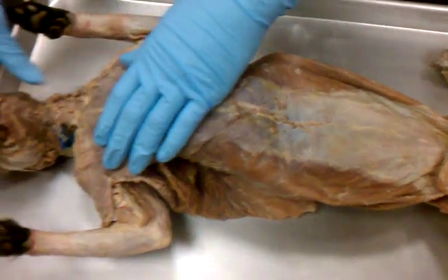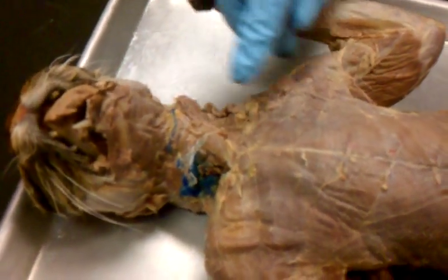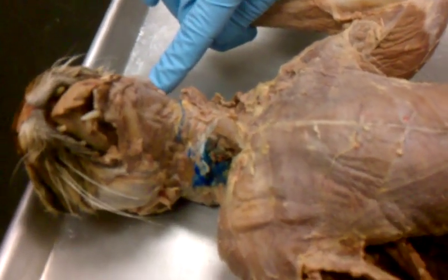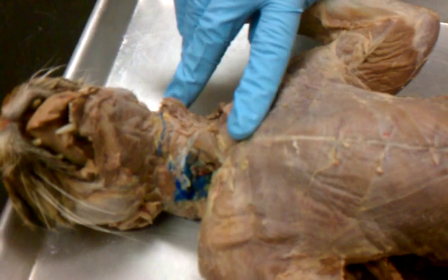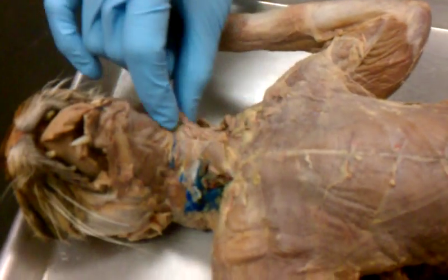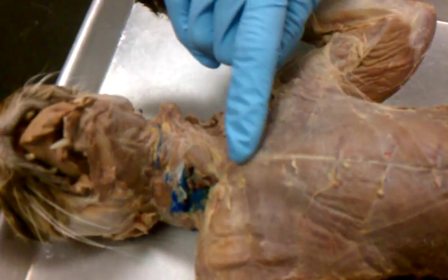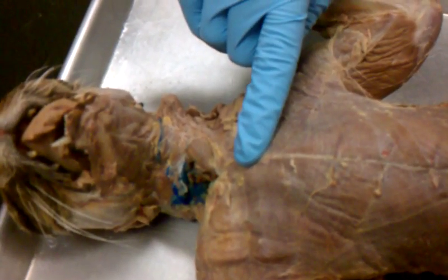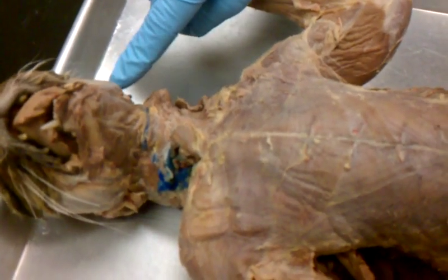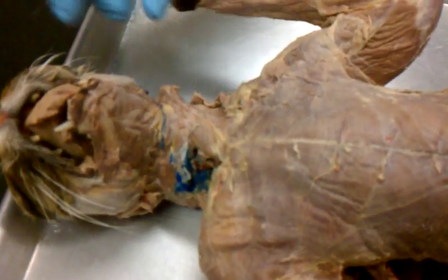Go for it. Okay, then you have this one in the neck that I told y'all is a good one to know because it goes from the sternum over the clavicle to the mastoid process of the temporal bone. Do y'all remember what that's called? This is the sternocleidomastoid. It goes from sterno, then over the clavicle, that's where the cleido is from, and to the mastoid process of the temporal bone. So sternocleidomastoid is this muscle right here.